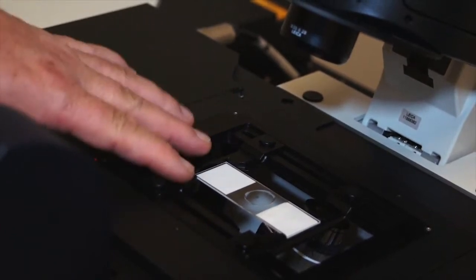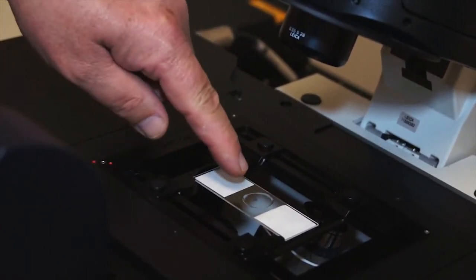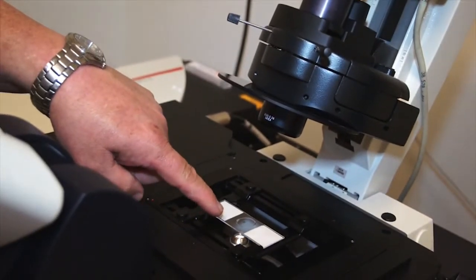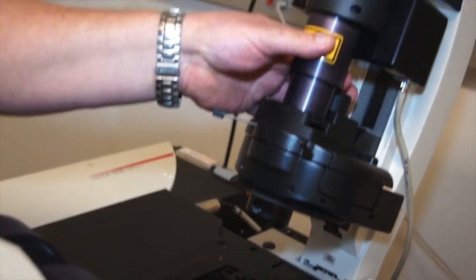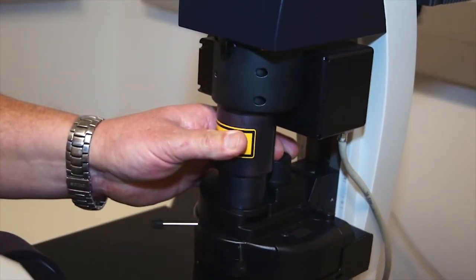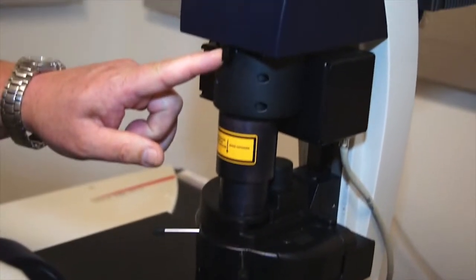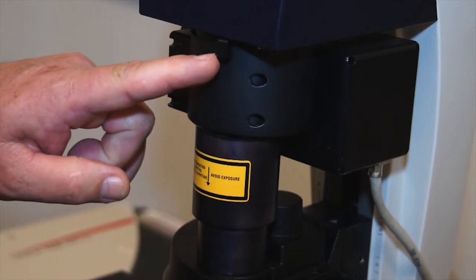In order to do Köhler illumination in the microscope, we first put our slide on the stage, dial the 10x objective into the beam path, and lower the condenser into place, also in the beam path. Now we focus our specimen on 10x, then close the field diaphragm down until we can see it in the field of view.